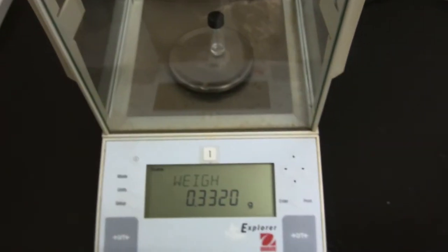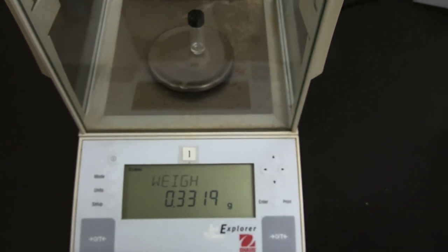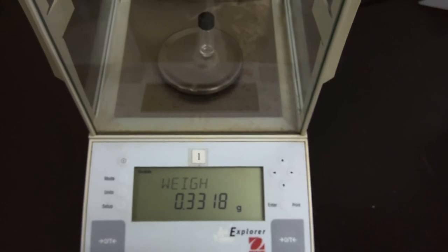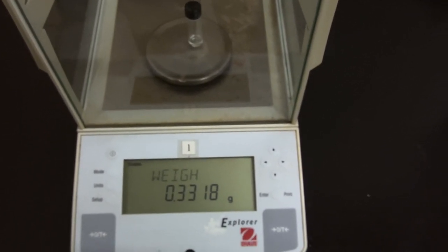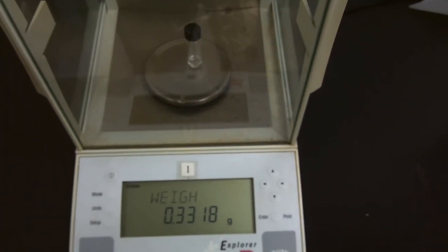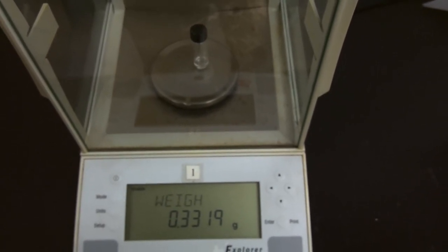From here, I would like you to record the mass of isopentyl acetate that we isolated after purification at the end of this lab, and from this mass value, you can calculate the yield for this reaction. From this, and including the data provided on Canvas, you have all the information you need to complete your report for Lab 8B.